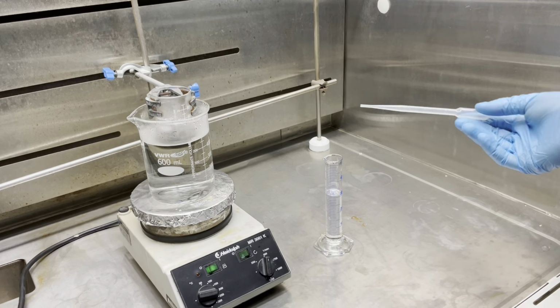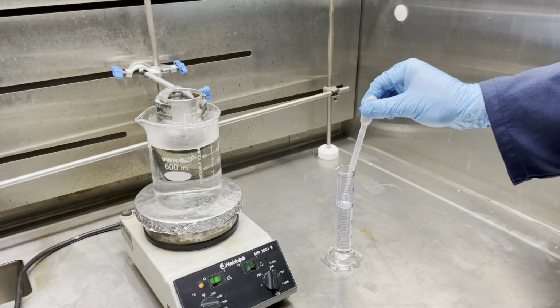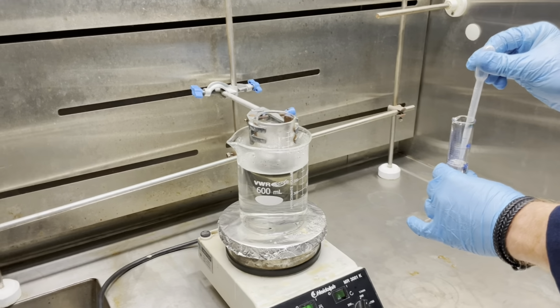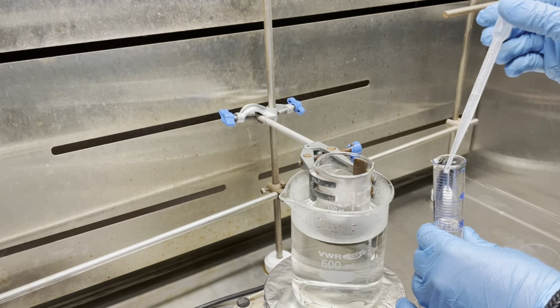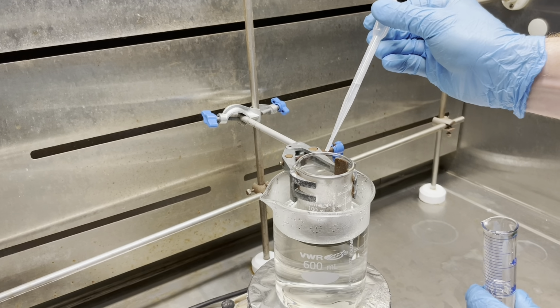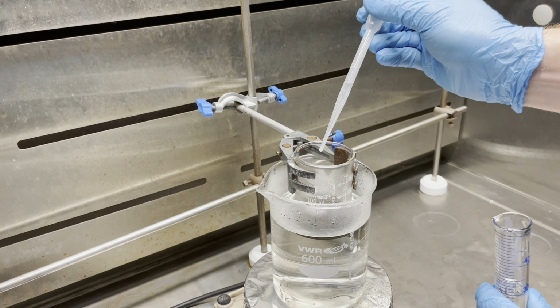We will now dropwise add our hydrogen peroxide solution using a dropper pipette, a plastic pipette, as shown in the video. The reason this needs to be done dropwise is the reaction is quite vigorous if too much hydrogen peroxide is added at once. We will first illustrate what happens when the reagent is added dropwise, and then what happens if too much of the reagent is added at once.